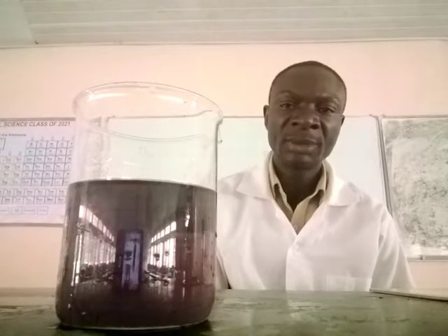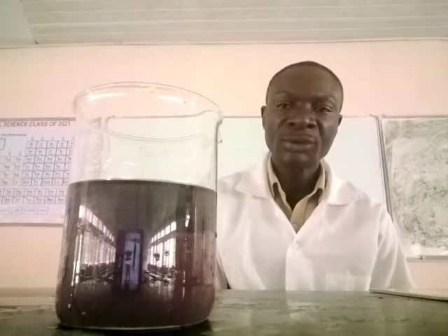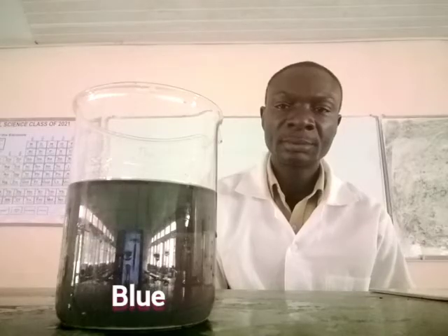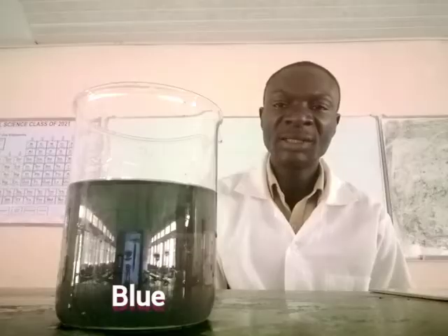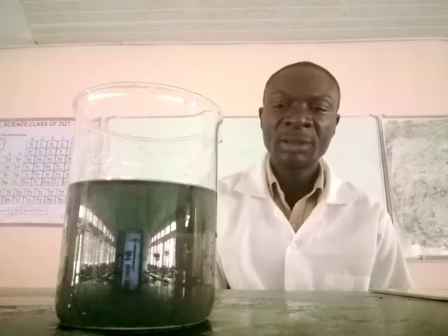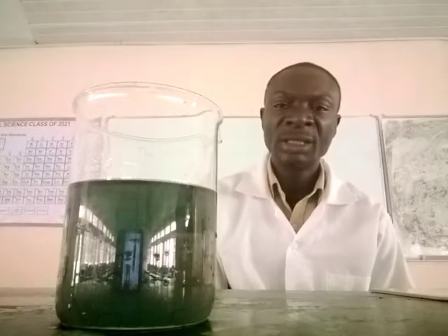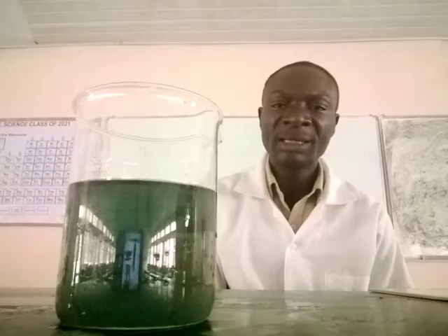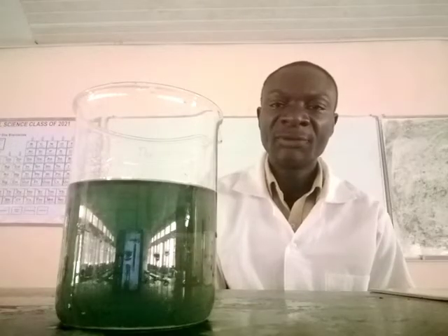It's now Mn6 plus. That is manganese 6 plus. That is going to the next oxidation state, the reduction process, manganese 5 plus.